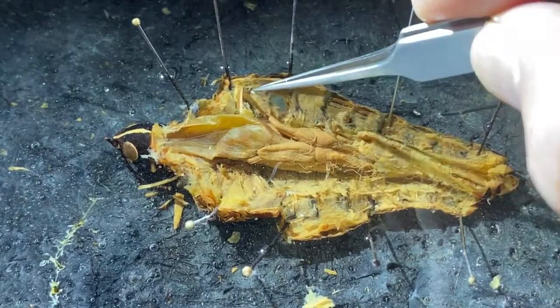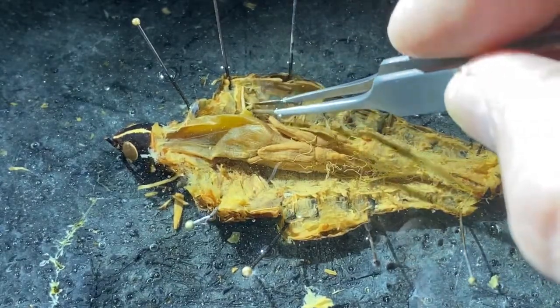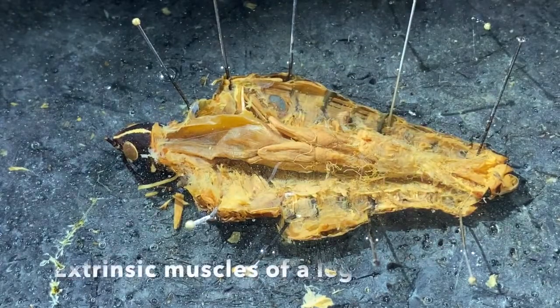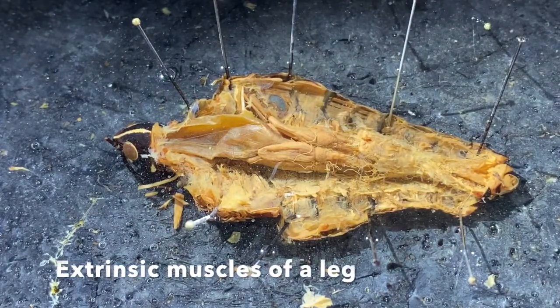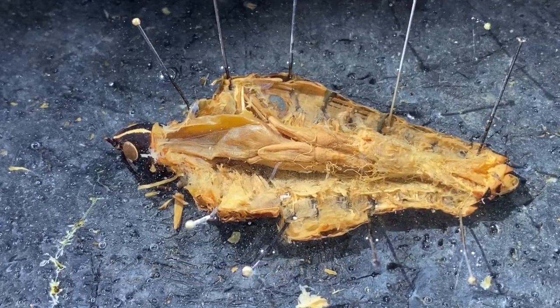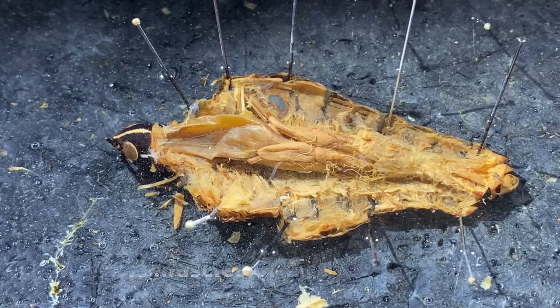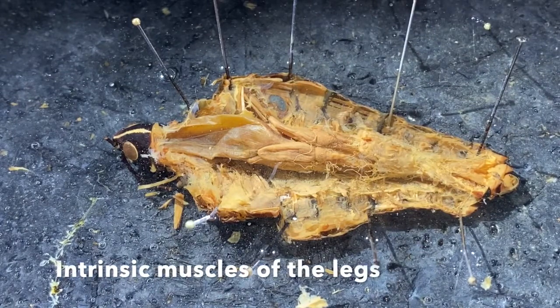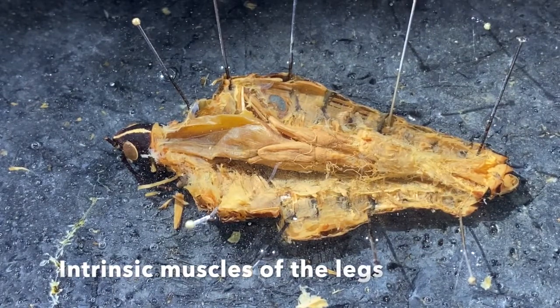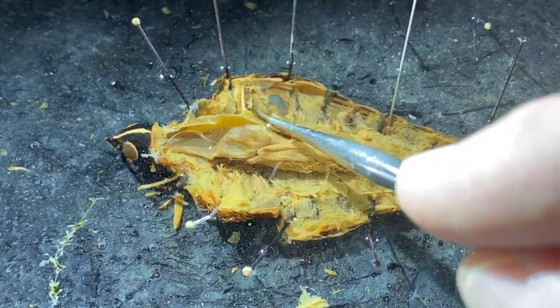Also, just anterior to this, these kind of brownish structures that you see, these are muscles. These muscles extend down into the legs. These are what we call extrinsic leg muscles. These are muscles that are attached down inside the leg and then come up and insert into the body wall of the animal. There are also intrinsic muscles that are found solely inside of the leg, for example, between neighboring articles of the leg, but these are extrinsic muscles up here.